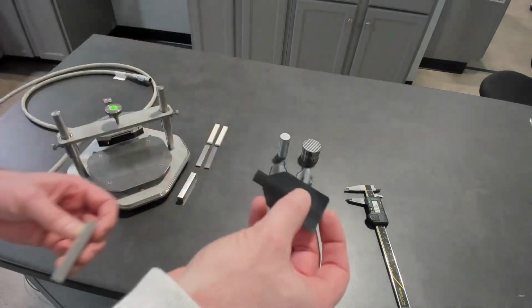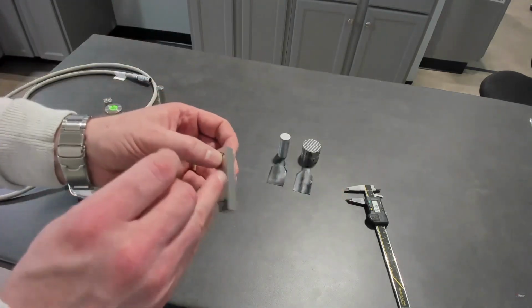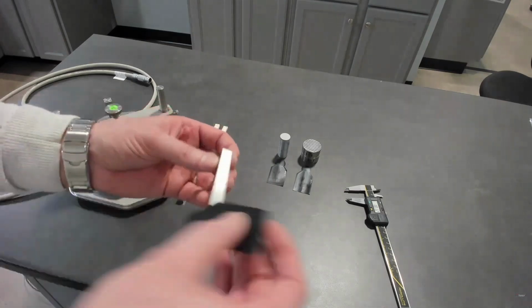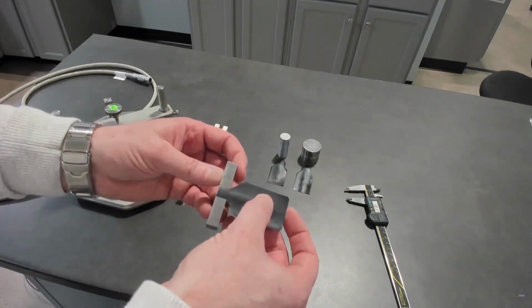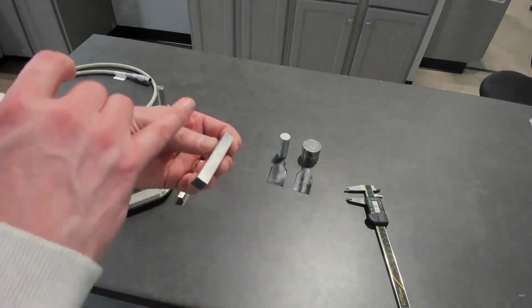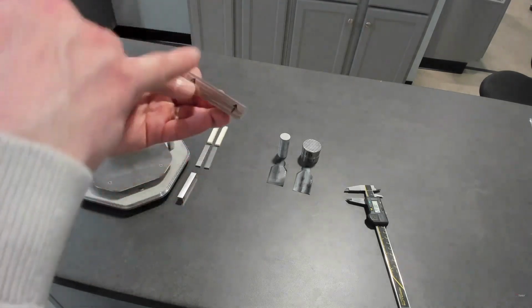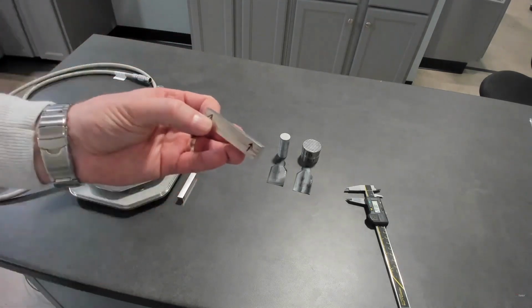With this same sensor and the same type of sample, this is isotropic, but if the sample was anisotropic due to fillers or repeating layers, I would be measuring an in-plane thermal conductivity and a through-thickness thermal conductivity and thermal diffusivity.